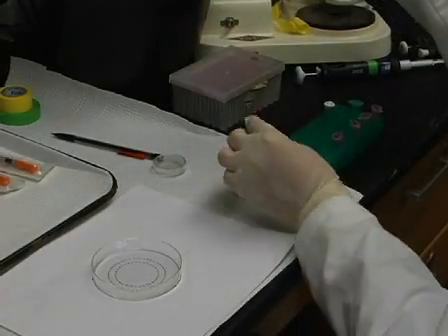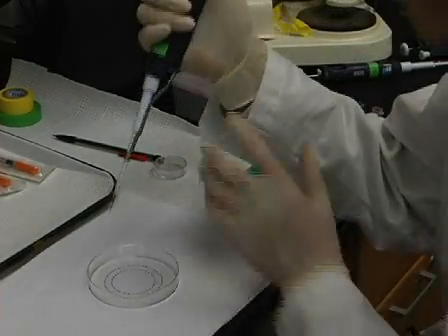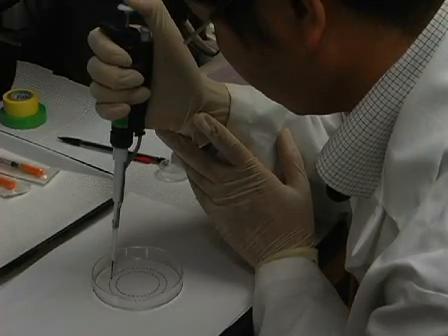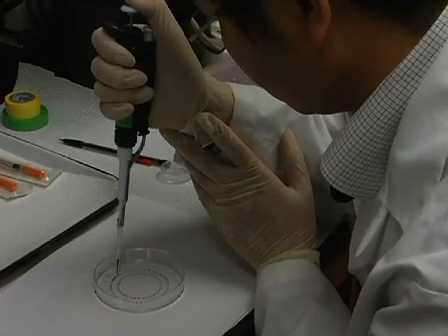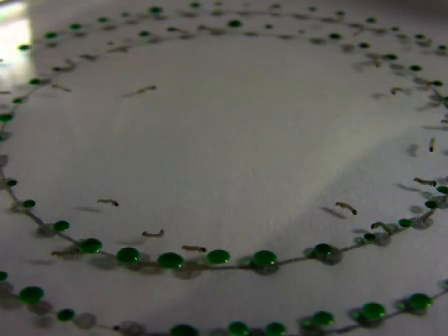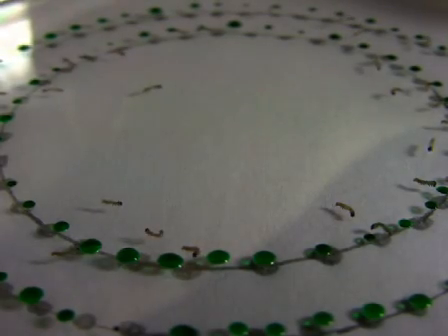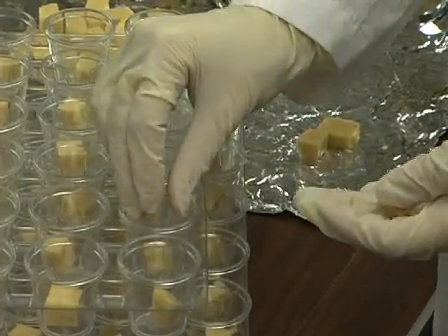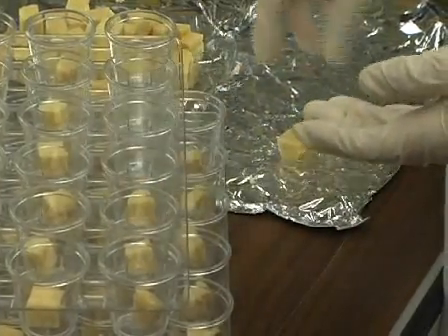Droplet feeding bioassays can be used for the determination of the lethal dose of a baculovirus and survival time of baculovirus-infected larvae. Early instar or neonate larvae are generally used for this assay. Before starting, make sure you have diet cups with the appropriate diet on hand. Also, prepare the appropriate virus dilutions.